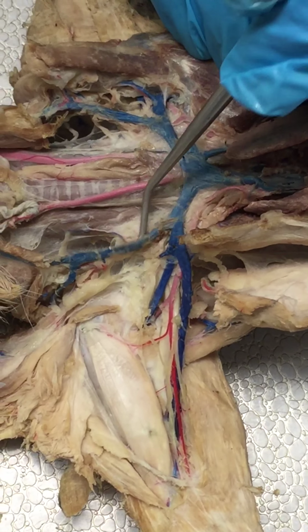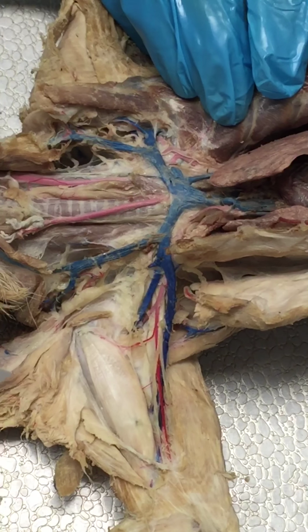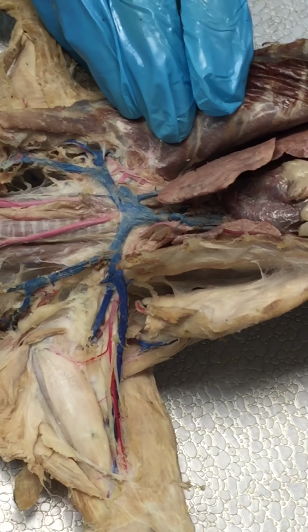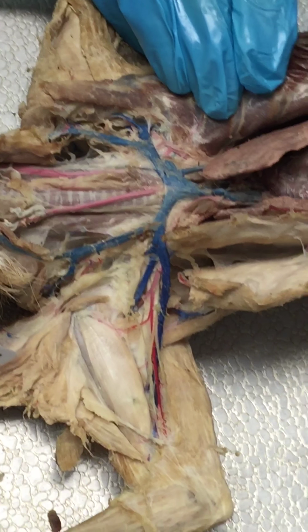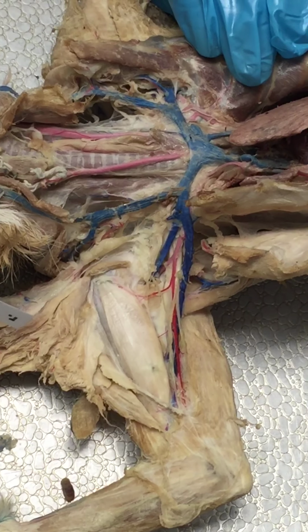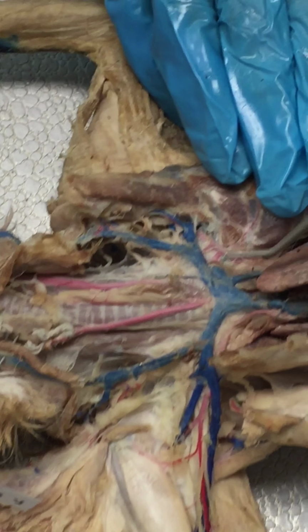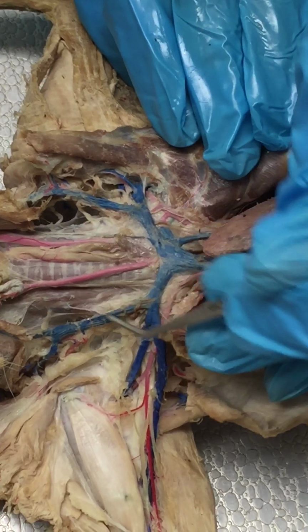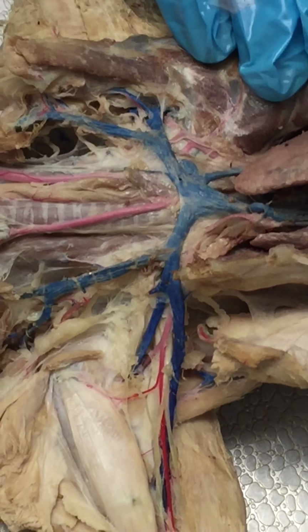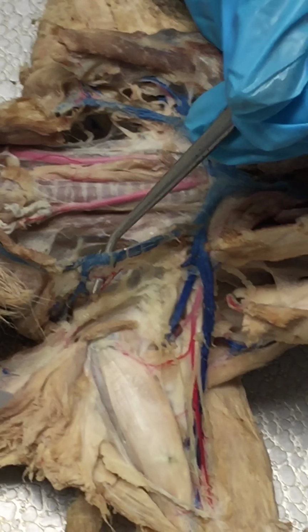So this would be your external jugular. Oh, okay. Well, let me say this. Coming from your brachiocephalic left or right, you have 2 branches. One is your external jugular, the other is your subclavian. So it's not like your left and right subclavian for your arteries where they're coming from 2 different positions. They're not. Your subclavians for your veins are coming both from your brachiocephalic vein. Okay? So left brachiocephalic vein leading to the left subclavian, right brachiocephalic vein leading to your right subclavian. Also, left brachiocephalic vein leading to your external jugular, and same thing over here, leading to your external jugular.